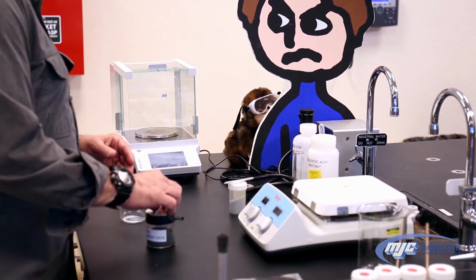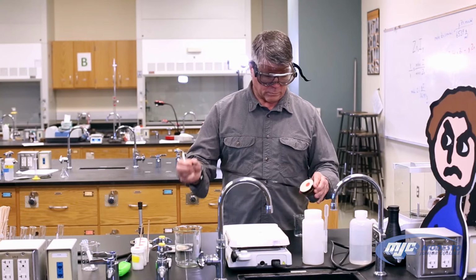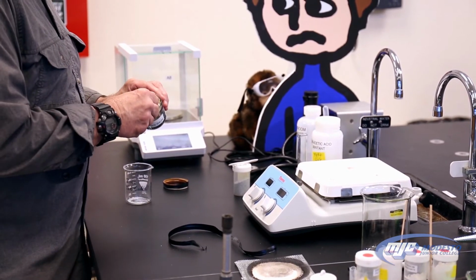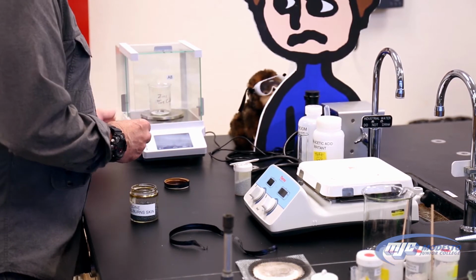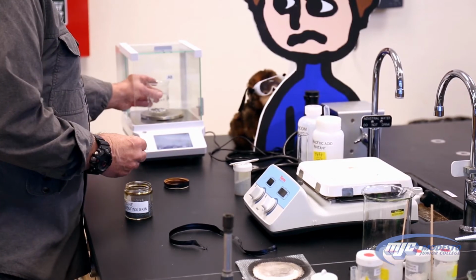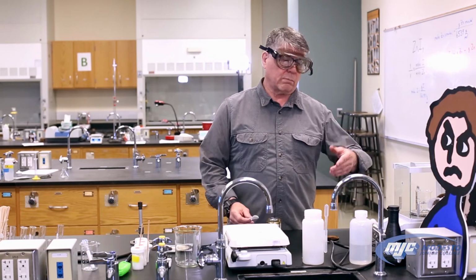Now we're going to add the iodine. We have to be kind of careful with this because once we put the iodine in, we can't take it back out because it starts reacting as soon as it hits the zinc. It really doesn't take as much as you think. It's in the form of these little tiny spheres. So just go a few spheres at once. And there we go. If it's a little bit over, that's okay because the way this is set up, zinc is in excess by far.